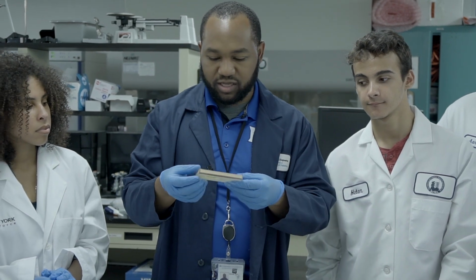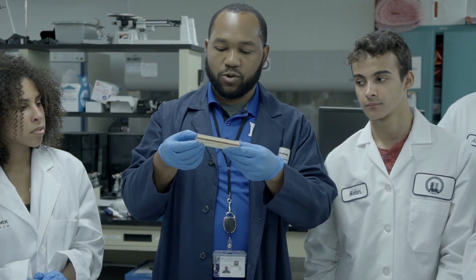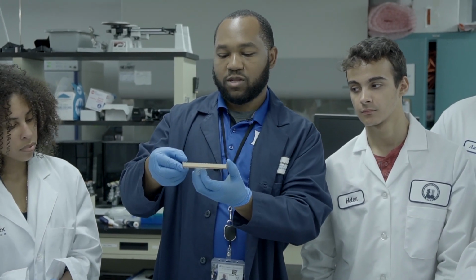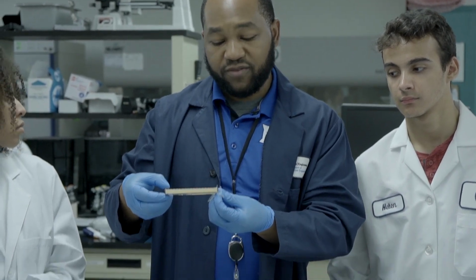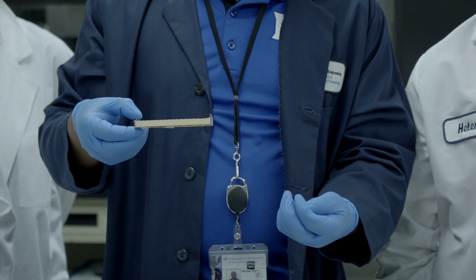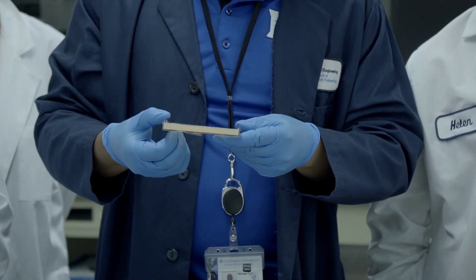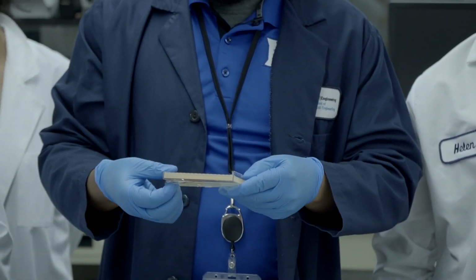First thing I want to do is, it's kind of slippery. Underneath, some of the gel when I poured it rolled under, so I'm just going to peel this on the bottom so it's not slipping everywhere. Not a requirement, but if you leave it on, it could slip around once you're actually injecting it, or once you actually place it in, which would not be good. So I'm just going to remove this extra gel from the bottom.